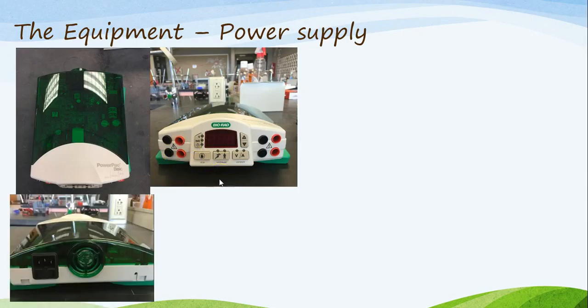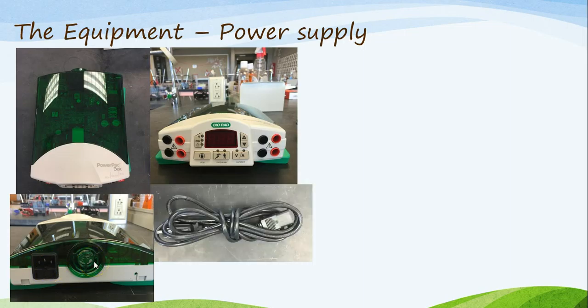If we're looking at the back side of the power supply, you will notice there is a fan and a place for you to plug in the power cord. The power cord looks like this. This end of the power cord gets plugged into this part of the power supply. And from there, you run the opposite end of the power cord into an electrical outlet. But only one electrical outlet, largely because there's only one plug.